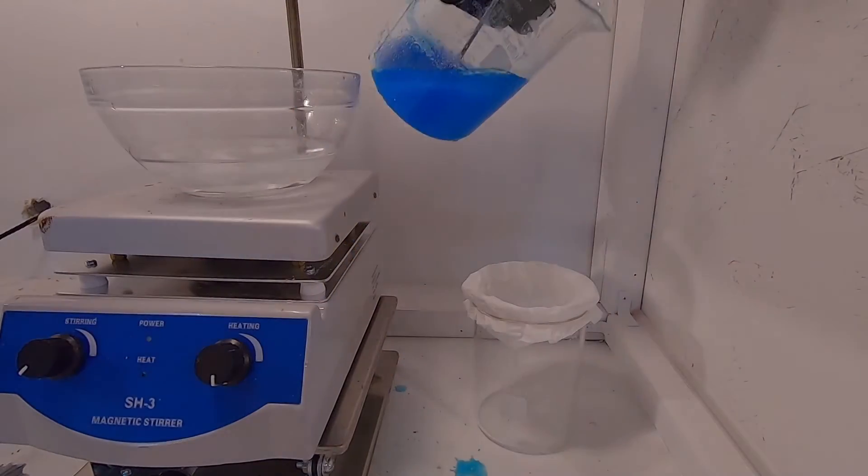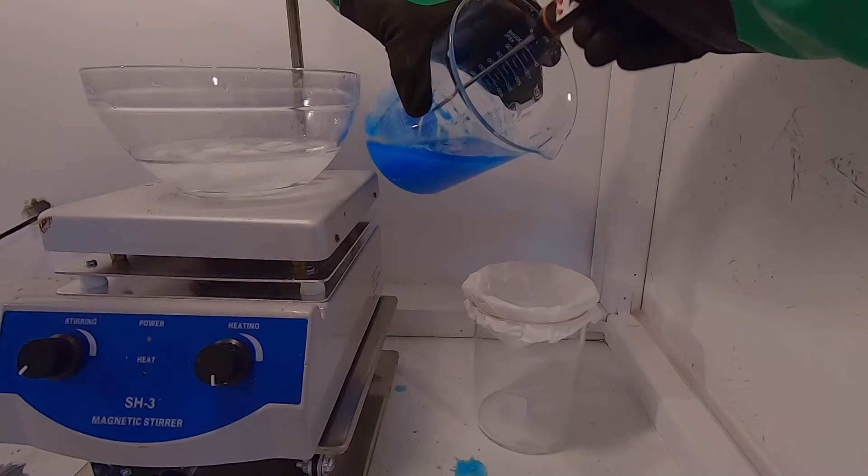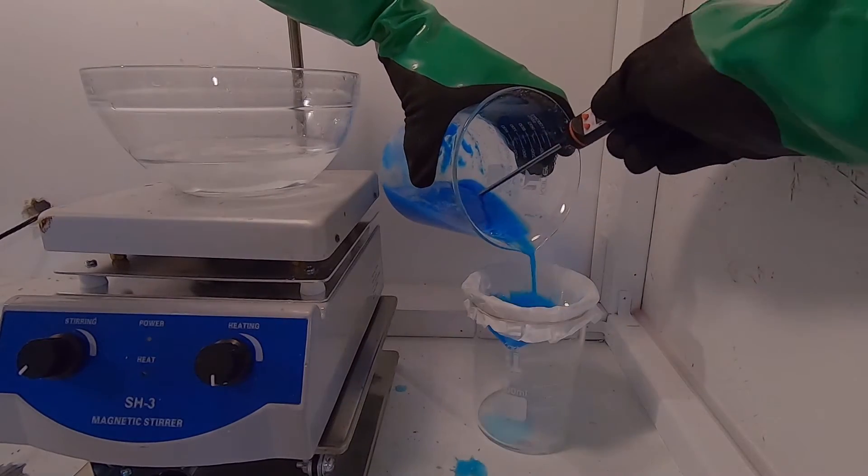And I quickly pour the solution through a new filter paper, collecting the crystals in the filter.